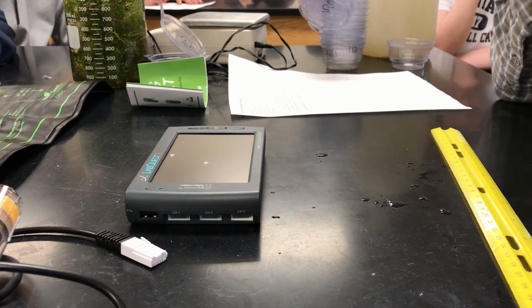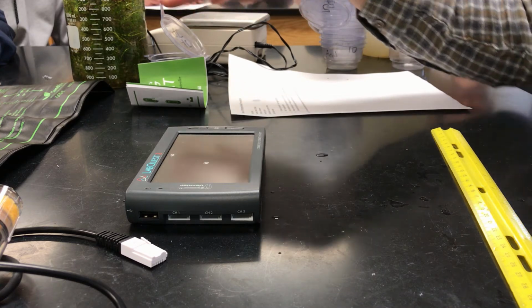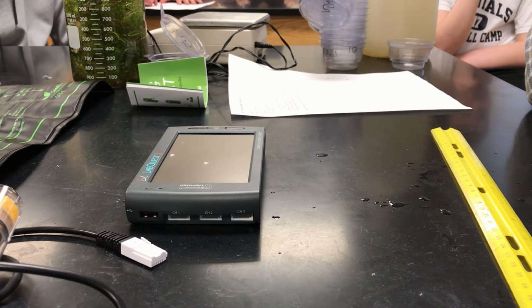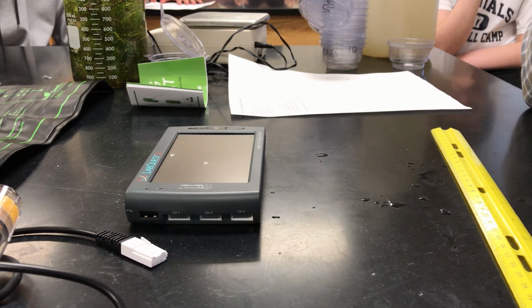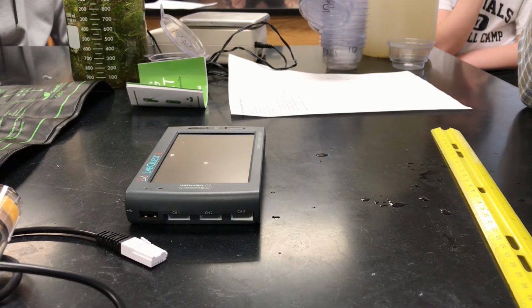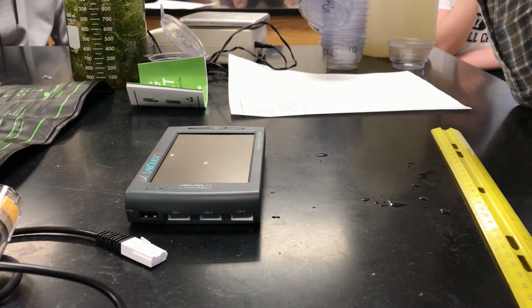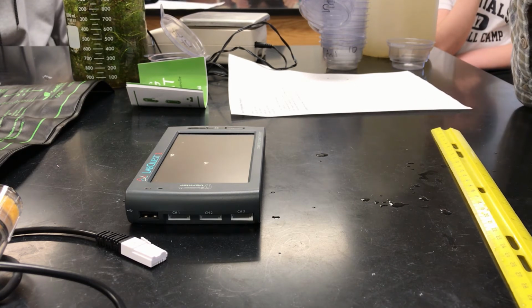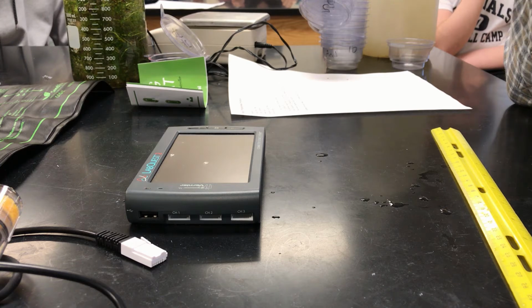And again, we'll have some different mats, so you will be able to take your containers and we'll have, I think, 4 different mats, and we're going to set those up either under a light in 258 or in room 254, out on the counter, and they'll all be in one location. Okay, so again, what's a variable you want all your tests under? You want them all under the same temperature, right? If you're doing a negative control, you'd want your negative controls exposed to that same temperature as well.